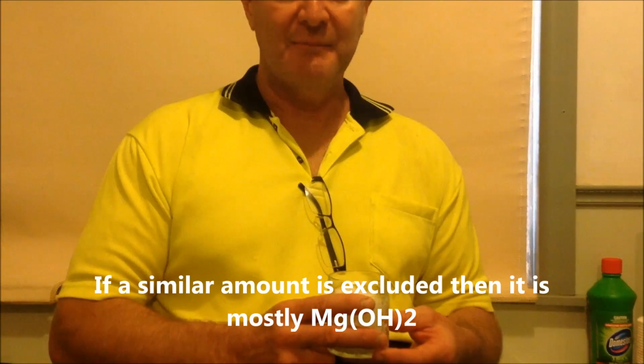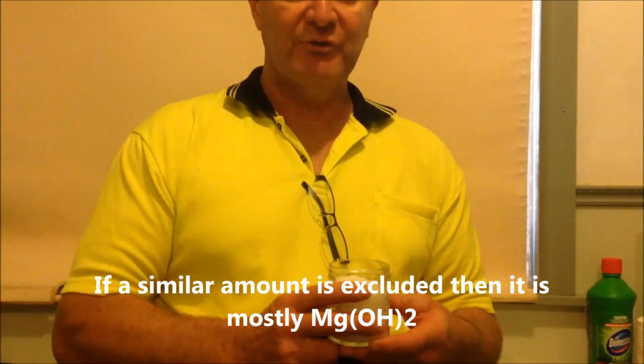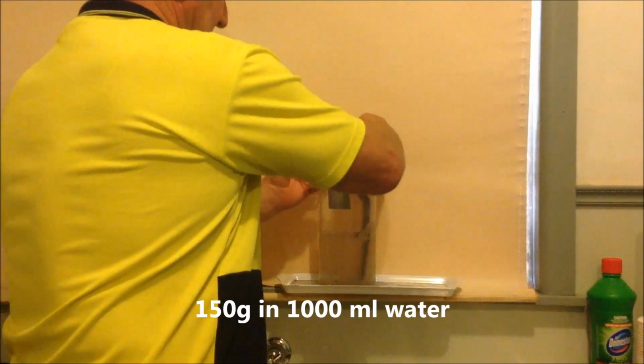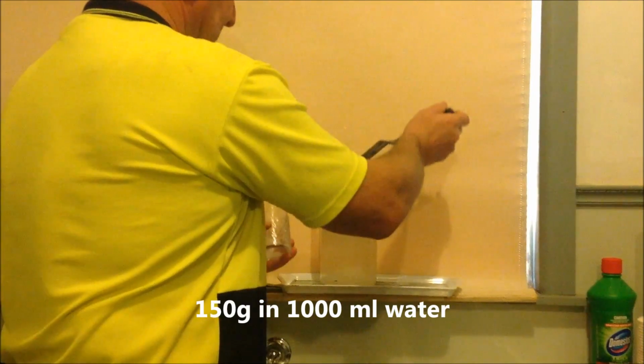and then take an equal sample size of that to the other and run both of them separately up to pH of 12. Now it's said that M-state material will be soluble at pH above 12, whereas magnesium hydroxide won't be, so let's find out. Now I'll add the Dead Sea salt and get that dissolving over the next 10 or 15 minutes.